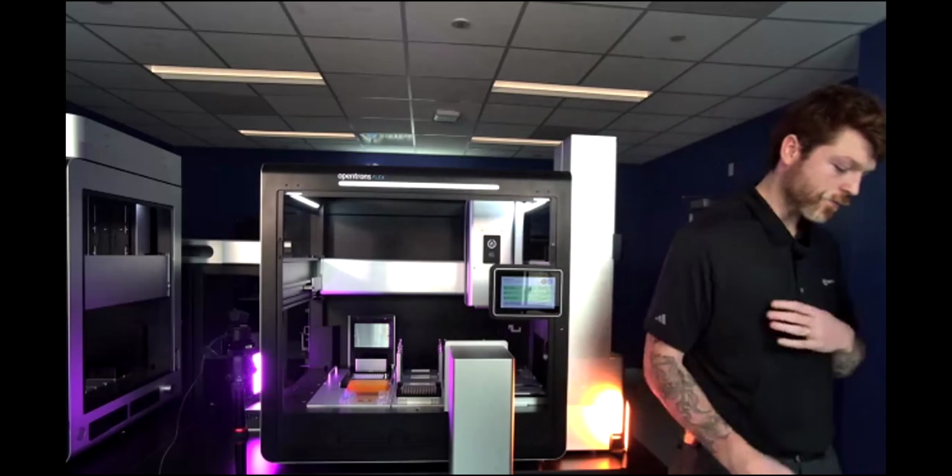So there's obviously huge benefit to automating these workflows. And there's also challenges in terms of tip management, preventing contamination, and also just the commitment to creating and also optimizing these protocols. So I'll hand it over to Matt here, who can go through some of the tips and tricks that they've used in order to enable this protocol.